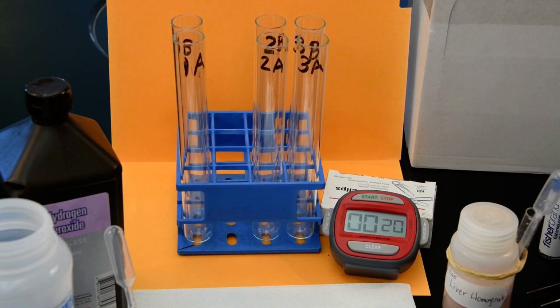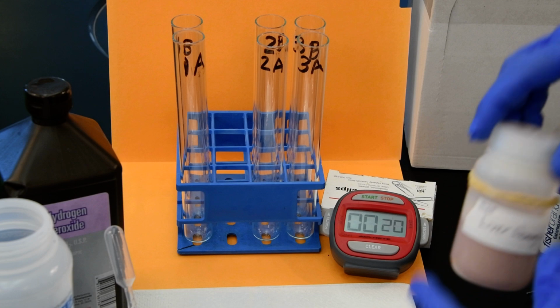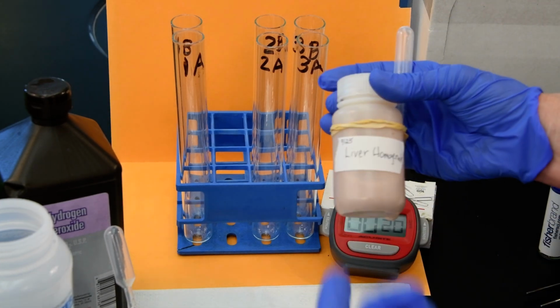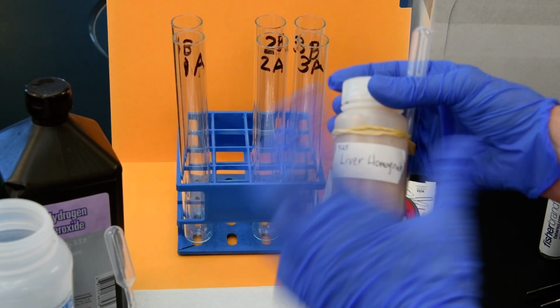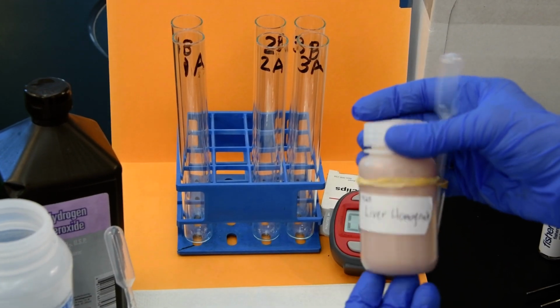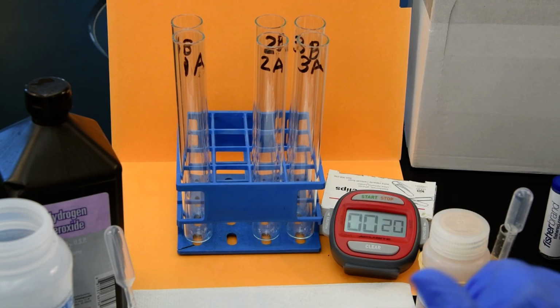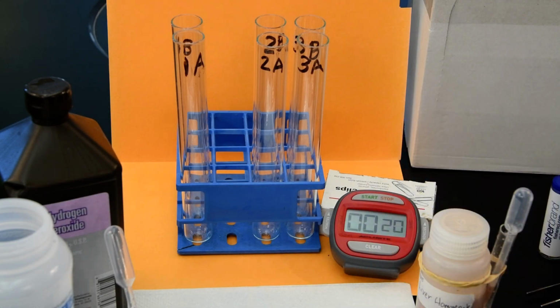Alrighty. So in this experiment, we're going to assess the effect of changing enzyme concentration. Again, I do remind you that we don't actually know the amount of catalase per volume, the unit of activity per volume. So we could have a source of error in that, and specifically in this reaction. But we'll see what happens here.